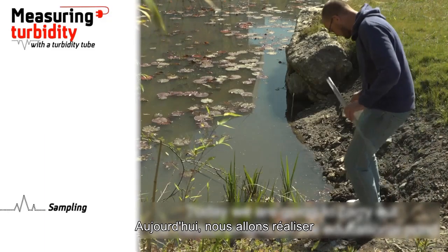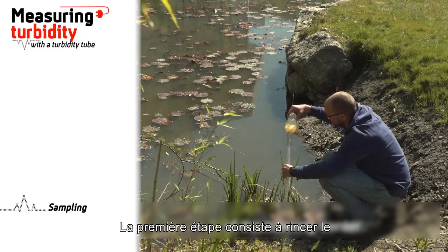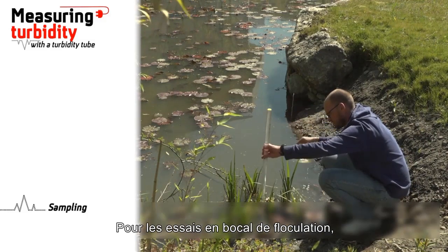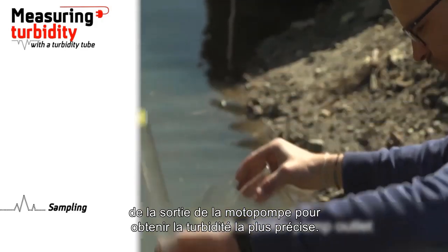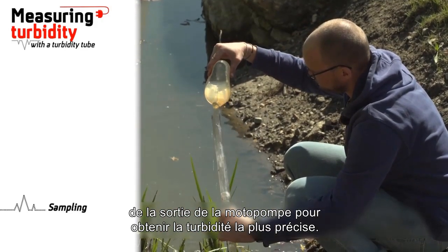Today we are going to carry out the measurements on the educational pond of the training center. The first step is to rinse the tube 3 times with the water to be tested. For flocculation jar tests, we recommend that you take the sample at the motor pump outlet in order to obtain the most accurate turbidity.